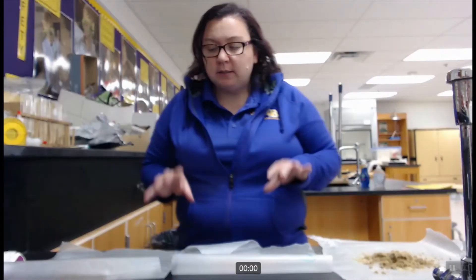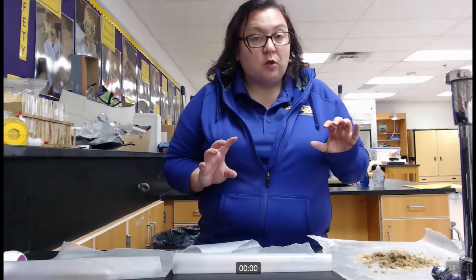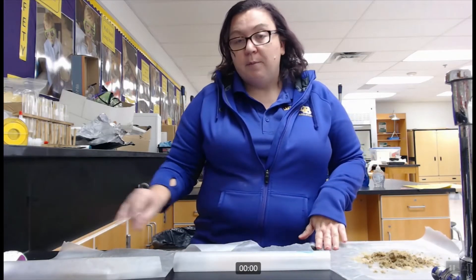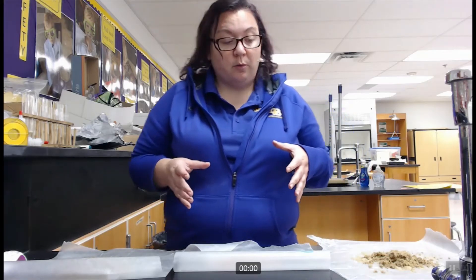Hello folks! Today we are going to analyze three soil samples in order to look at texture by feel. We take our dry samples that have been run through a mortar and pestle so they're smooth and any large chunks are broken up, then we add water and perform some different tests and go through our flowchart.